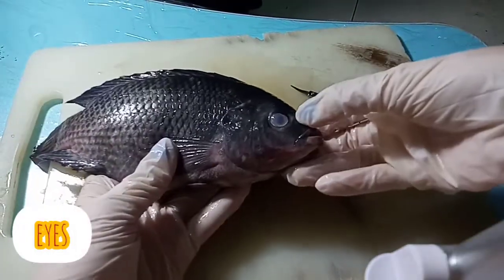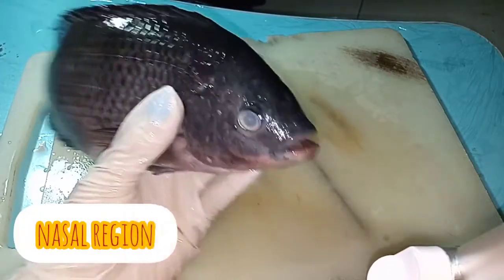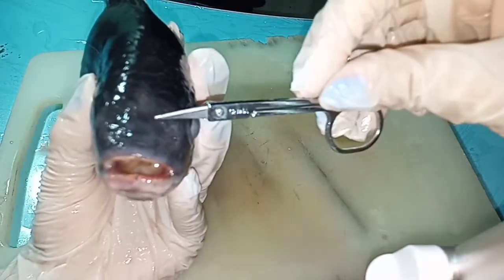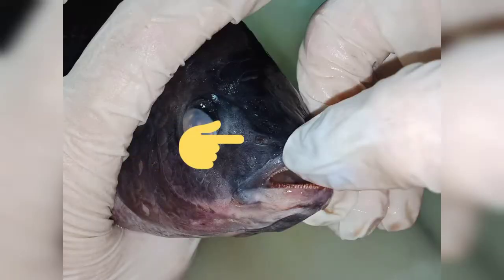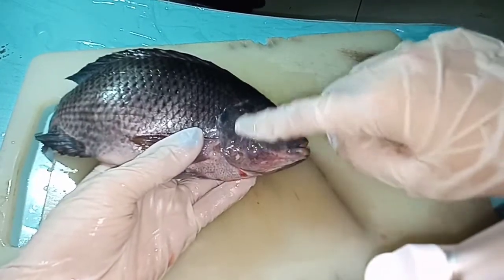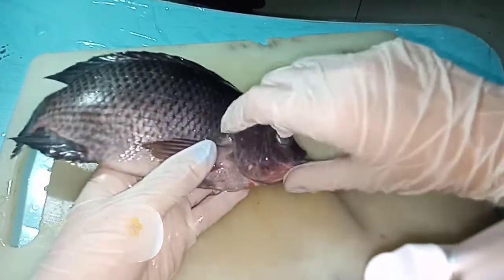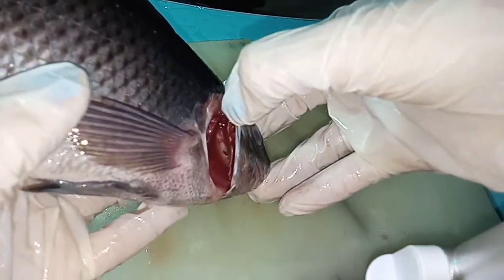Next is the eyes. This is the eyes. Next is the nasal region, which is this one. It's just small, so we couldn't see it clearly. Next is the scales that are covering the gills — it is called the operculum. If we open it up, you could see the gills.